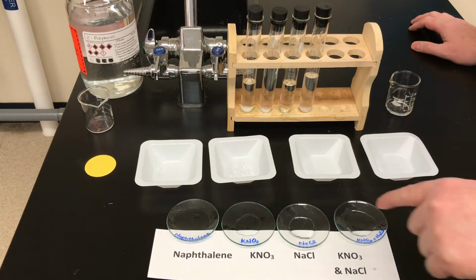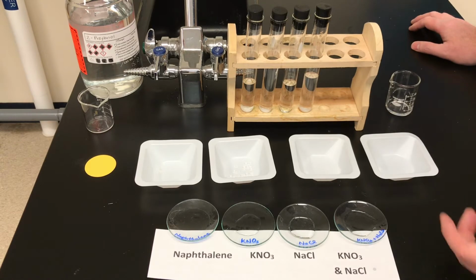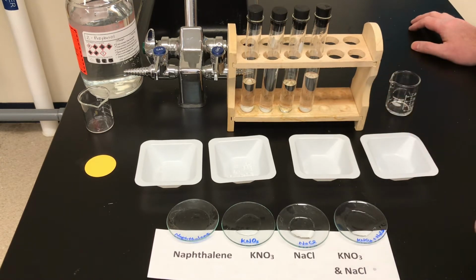That doesn't allow us to view any individual crystals, but rather just this clump of solute. Yeah, so we want to see here tomorrow individual crystals of the salts so we can examine their shapes. So two things: you want to use a dilute solution to do that, and you want to let it evaporate slowly to form those crystals. So we're going to stop the video here, and tomorrow we're going to come back and examine the watch glasses to see what the shapes of these crystals look like.